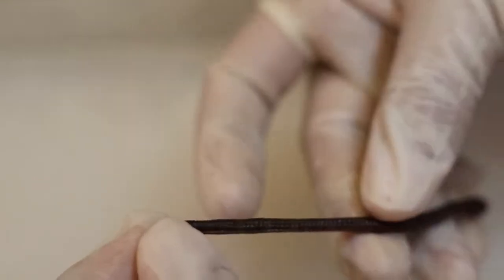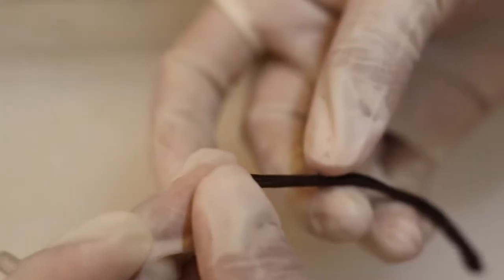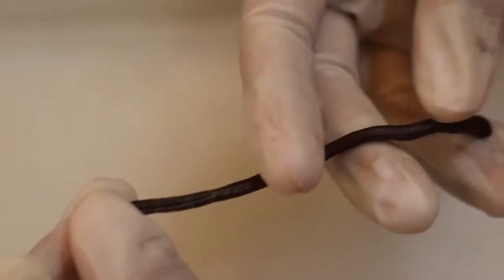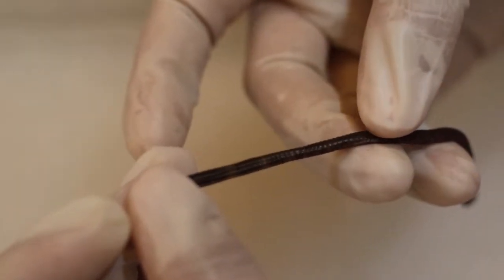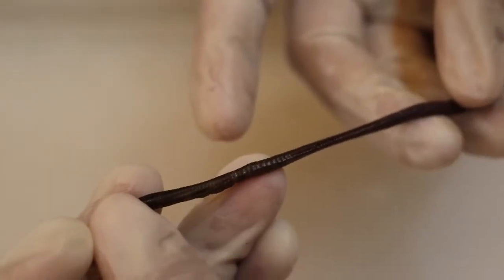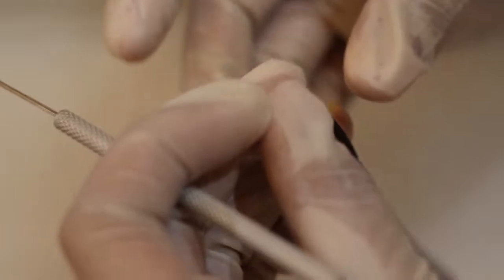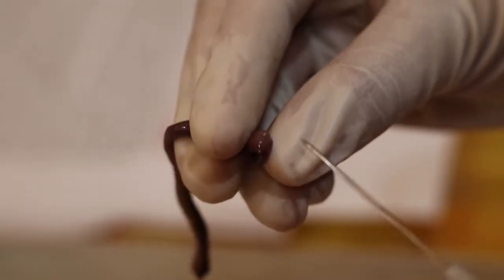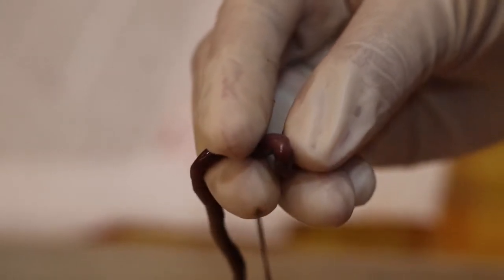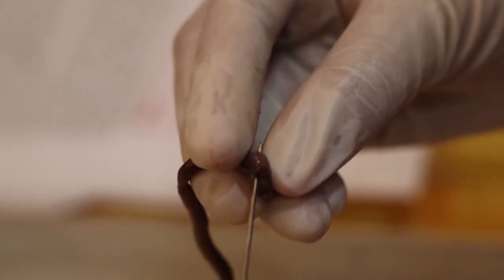So as we feel the body of this earthworm, we can feel bristles. This is what you call setae. It helps the earthworm for locomotion. So the setae and the break in the clitellum indicate the ventral side. As you can see, there are two pores right here. These are what you call the nephridial pores.